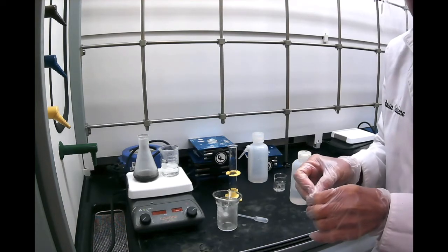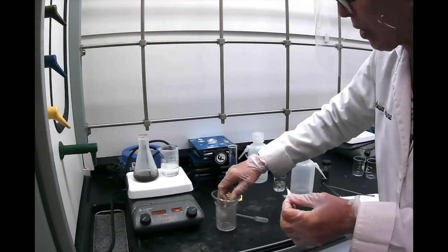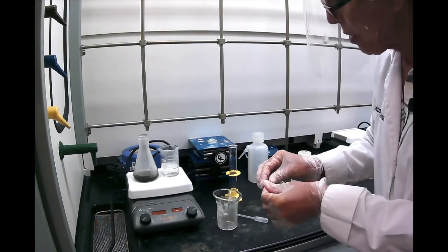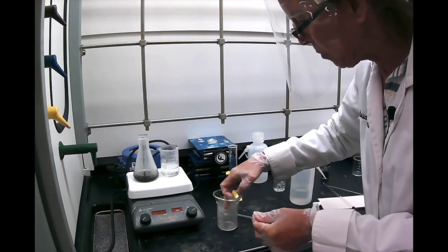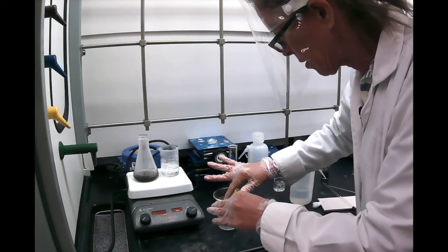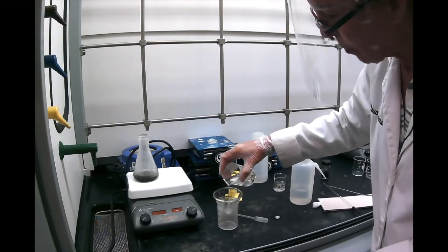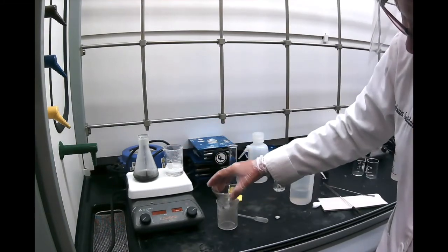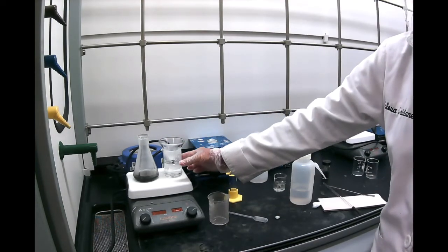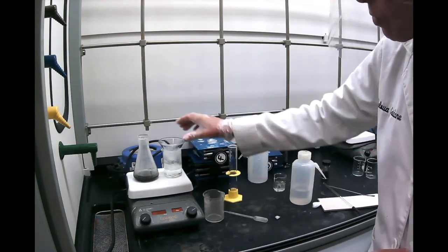You're going to have a lot of crystals on top, and you have to keep dissolving and dissolving. So it's best to have a decent flow, but not too slow of a flow. So let's try one more time to have another cotton plug in there. And make sure your hands are clean. I'm using gloves, but just put a little hot water. So this time it looks like it's working better. And make sure your funnel is hot. That's the reason I put it here on this beaker with hot water, to heat it a little bit so the crystals don't crystallize too quickly.